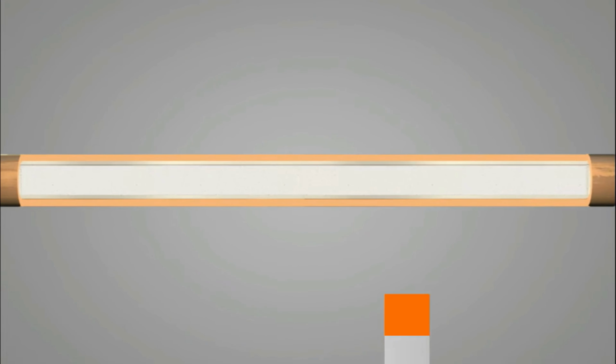You can see here different electrodes, like the polarization electrode and collector electrode. The sample will come from this electrode to the collector electrode, and whenever the sample comes from here to there, this will cause some resistance or voltage or current in the collector electrode, and this current would be measured by the detector.